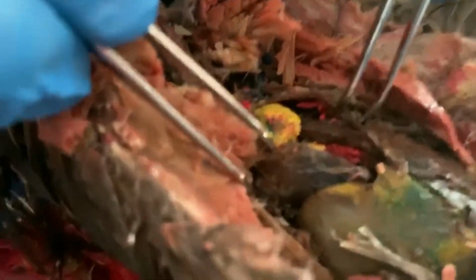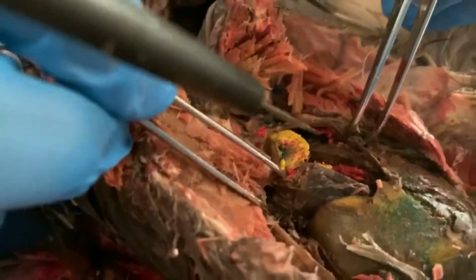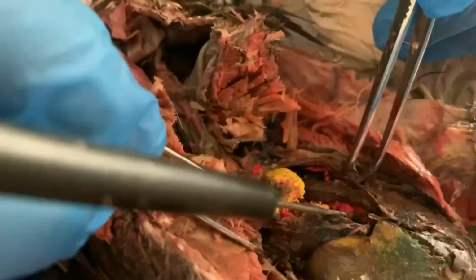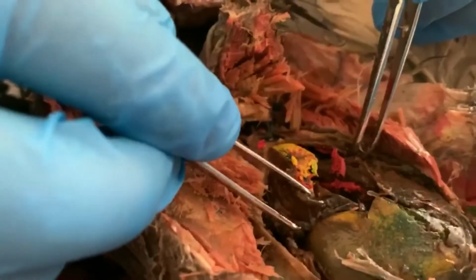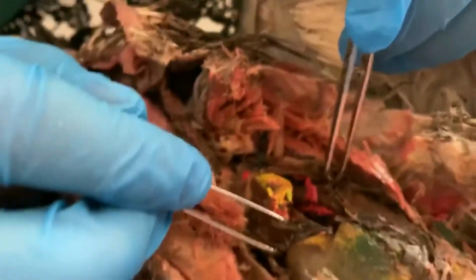All right, so looking inside the heart, you can see, let me get the poker. Here is one of the atria. Here's the other atria over on this side. The ventricles are the lower segments of the heart. So you can see here that we've got both this left and right chamber. We also, of course, have the pink stuff. The pink stuff is the vasculature, because these birds have been dyed just like the frogs were.